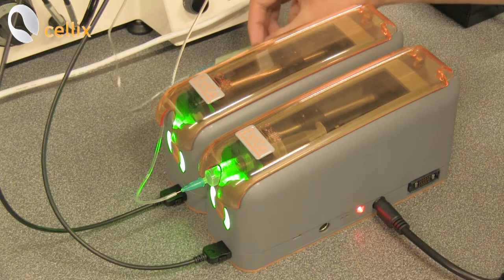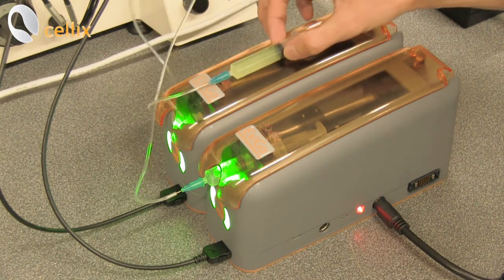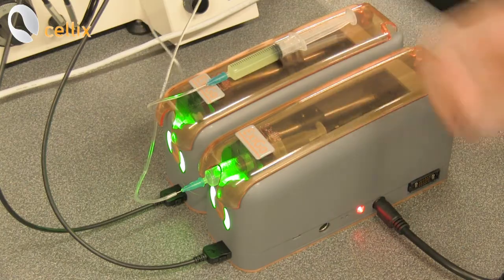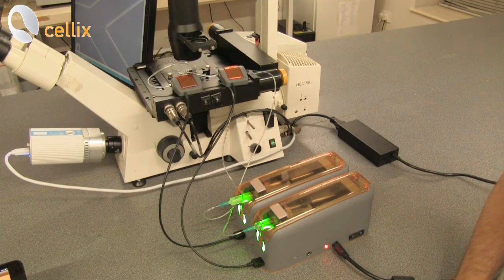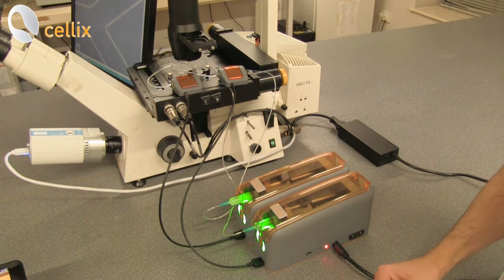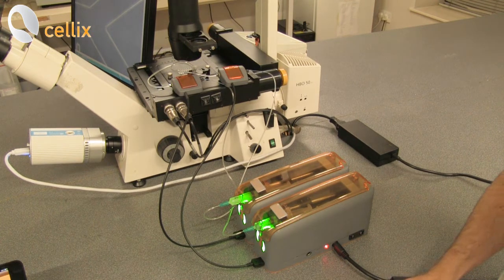We proceed with the same operation for the syringe which contains the dispersion of particles. Now the two Exigo pumps are ready for the experiment. We just need to make sure that the tubing are filled with their respective liquids.